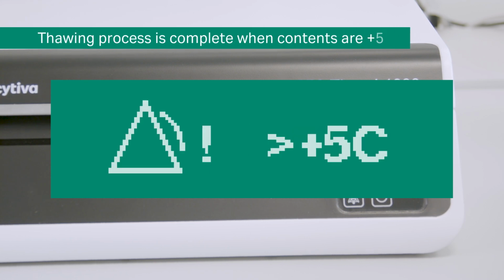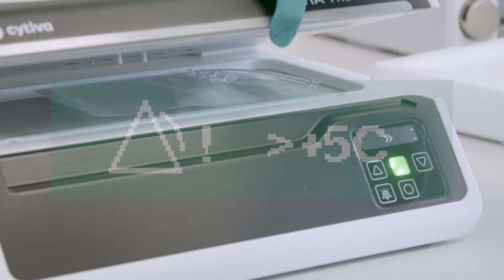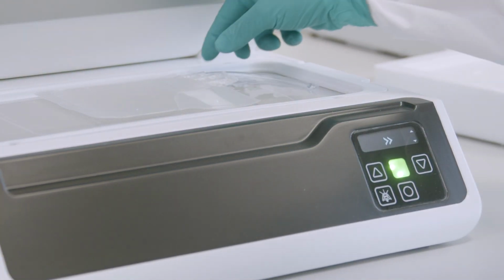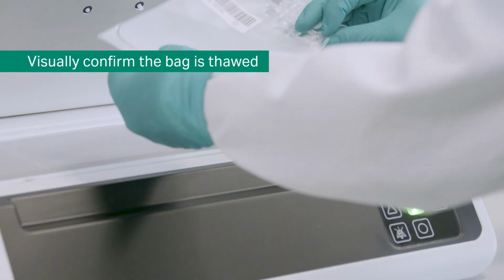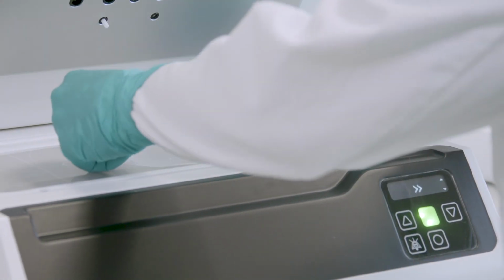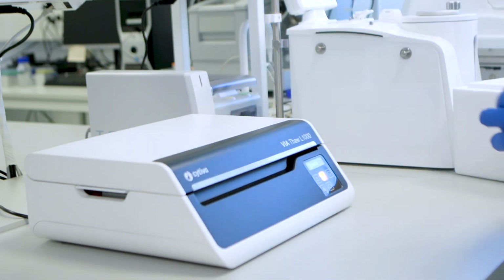When the bag contents are around 5 degrees Celsius, the instrument displays the end of thaw message and an acoustic alarm sounds. Opening the lid, an operator can check if the cryobag is completely thawed or not. Based on this observation, you can select to complete or continue the thawing process. Incremental thawing at every 5 degrees starting from 5 degrees Celsius can continue after each end of thaw sequence.